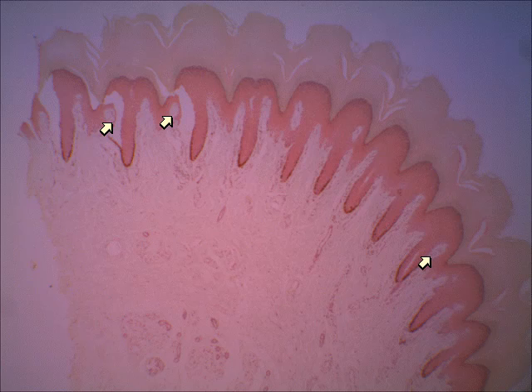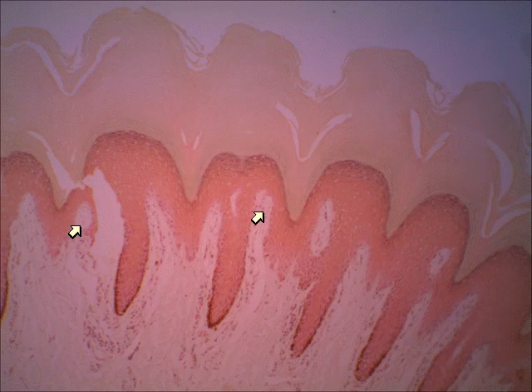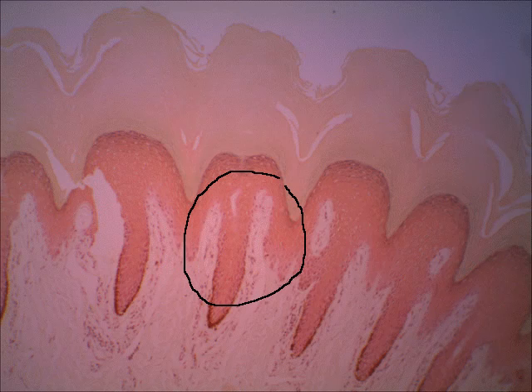On this next slide, you're going to see some of these areas on a higher view. We're going from scanning to our low-power objective, and I see a Meissner's corpuscle right there. You can tell it's a Meissner's corpuscle because — I know this sounds silly — it just looks kind of swirly. It looks like a little tornado in there. I believe there's another one right here at the tip of the pointer, but on this magnification, that's difficult to see. Moving to the next slide, you're going to see this area on a higher view.